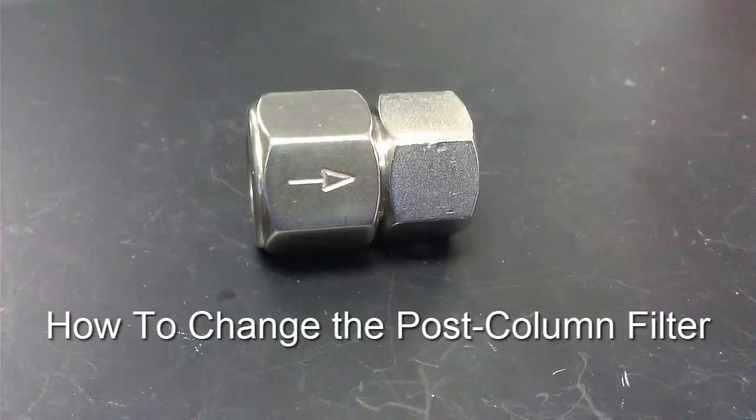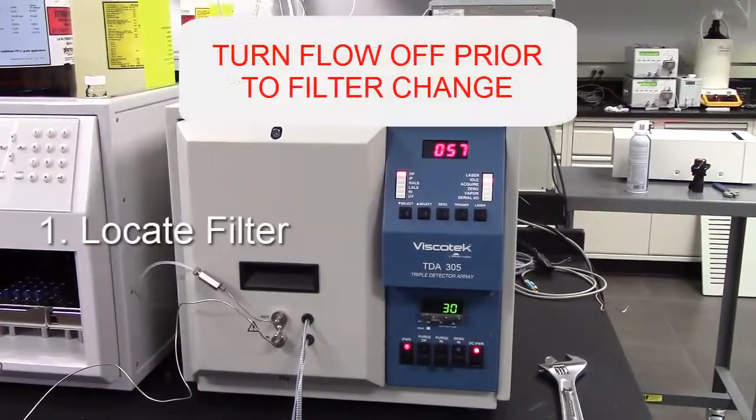How to Change the Post-Column Filter. Step 1. Locate the filter.